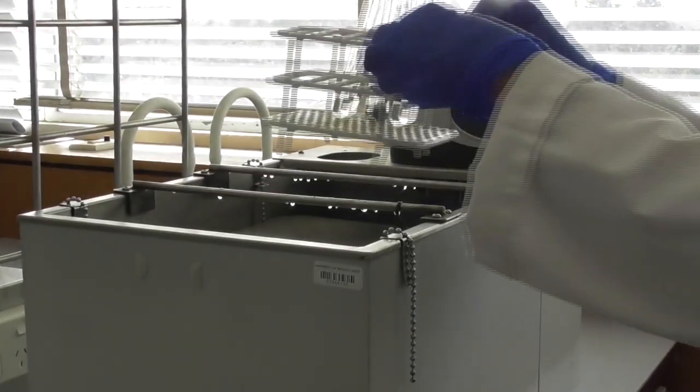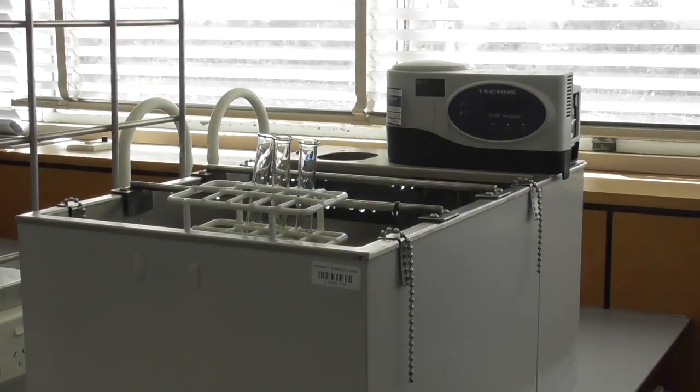And then we put the test tubes into a water bath at 60 degrees for two minutes.